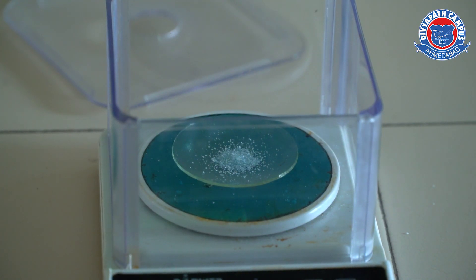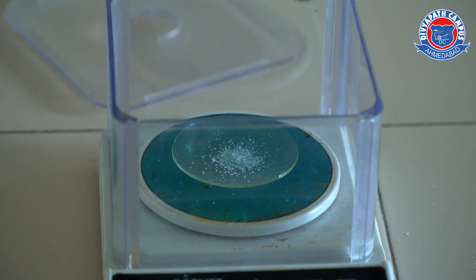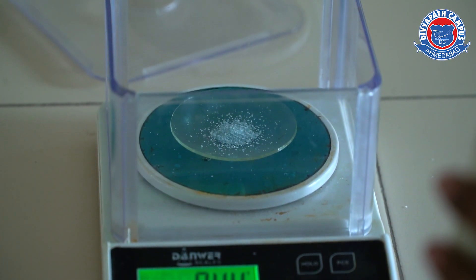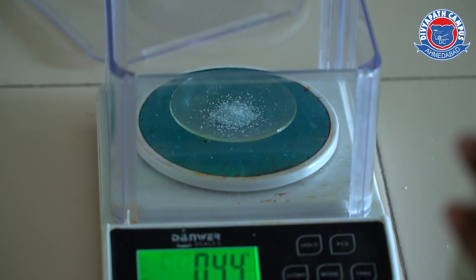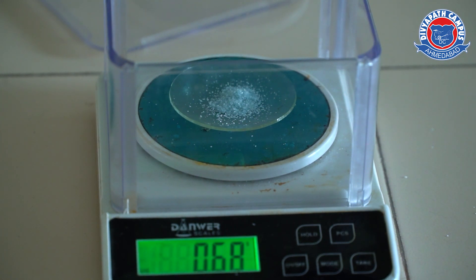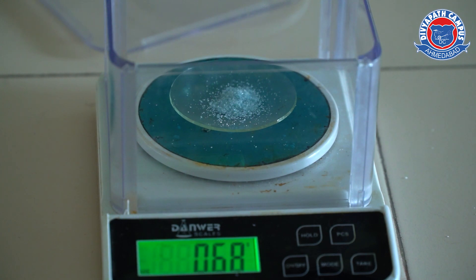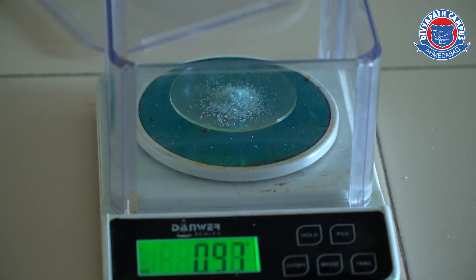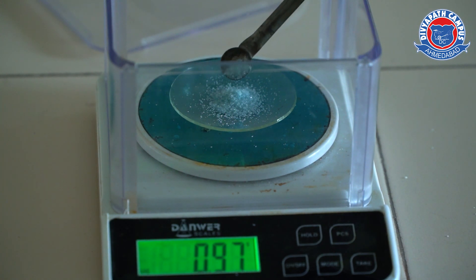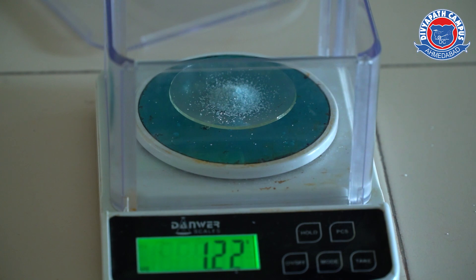The molecular mass of oxalic acid is 126 grams. If you dissolve 126 grams of oxalic acid powder inside 1000 ml, then the solution is 1 molar. But here we need 0.1 molar oxalic acid, so in 100 ml we need 1.26 grams of oxalic acid powder dissolved in 100 ml solution.